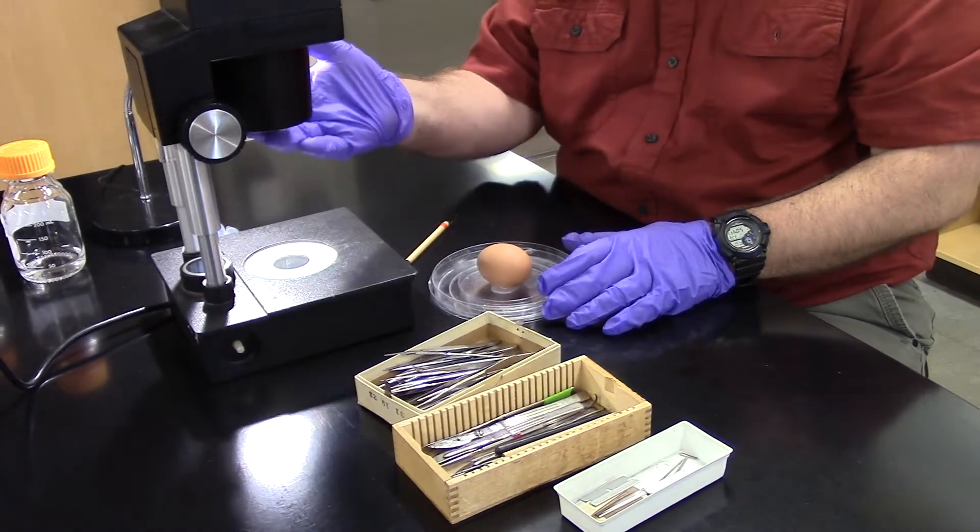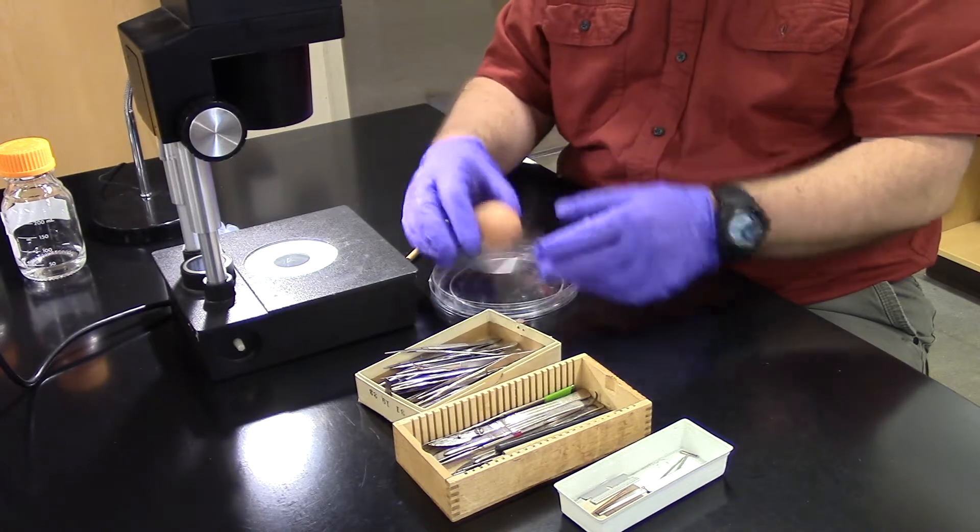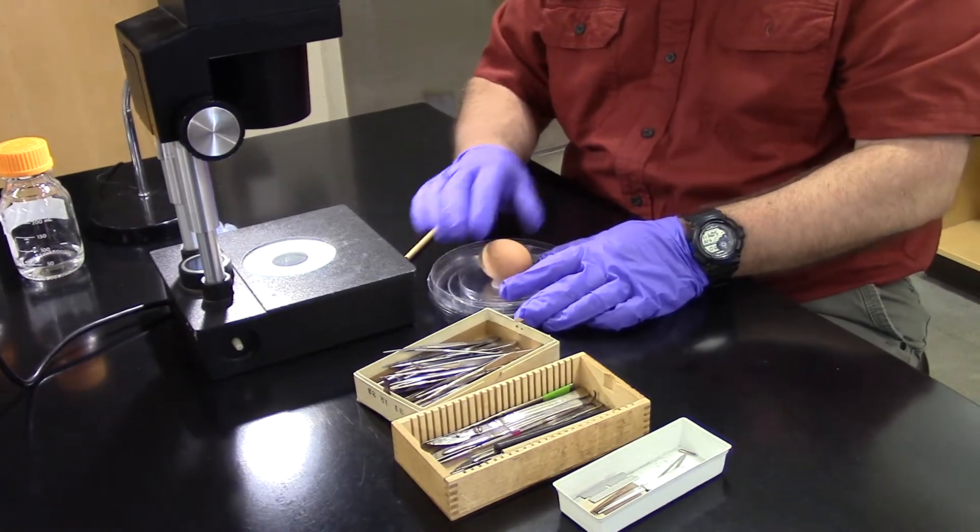Now we've got a microscope and we've got the egg. Wax has dried, or cooled, so the egg is fixed in place.